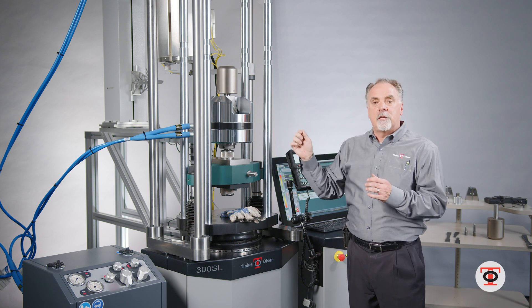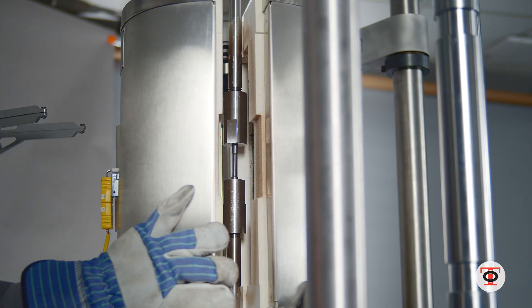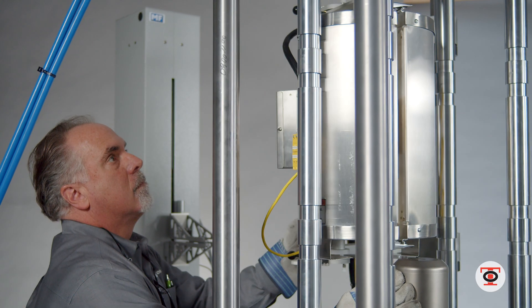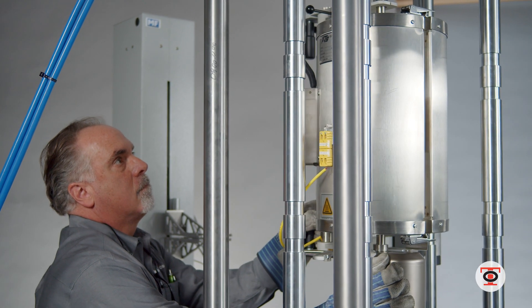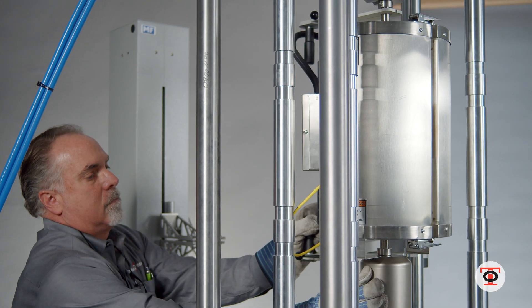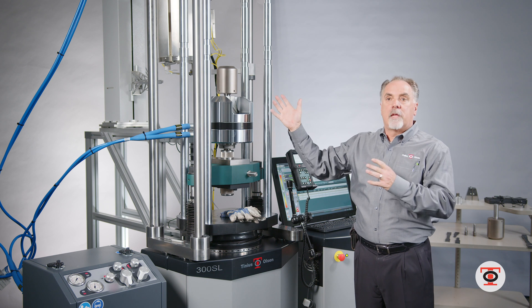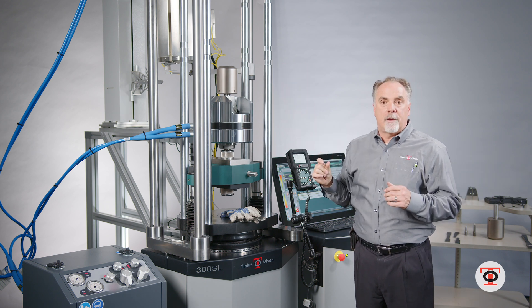I have a 252 threaded specimen under high temperature that we will swing into view and show how the sacrificial stud with the adapter sliding the load train in place will give you ease of use for your high temperature tests.